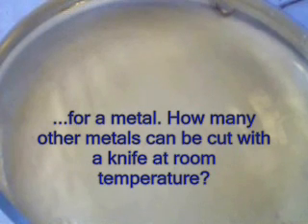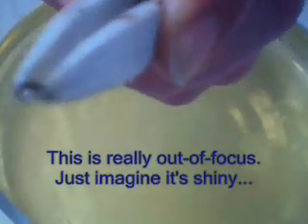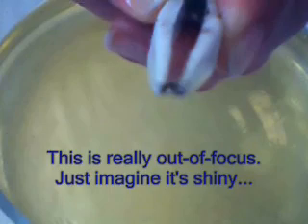Let's see. Lithium is quite soft — about the hardness of sort of frozen butter, I would say. So I've got a very small amount of lithium here. I'm going to cut it now, and I'm going to hold it into the camera. Let's see if you can actually see that it's just shiny where I've cut it. You're going to have to look very quickly. Can you see that shiny? Just a very little bit.